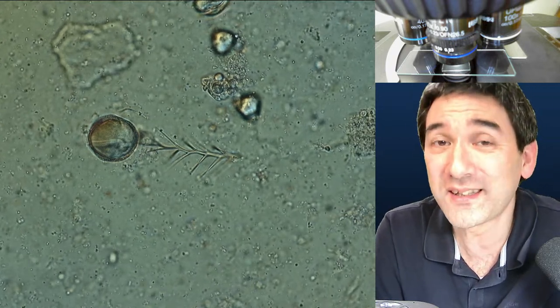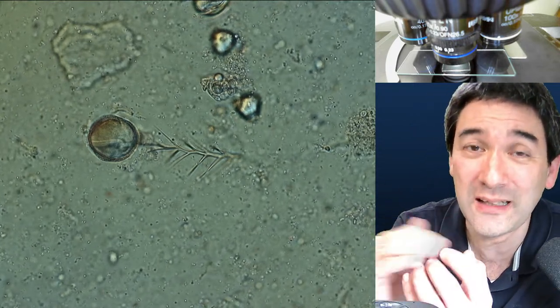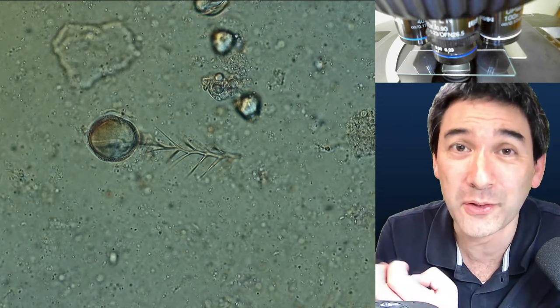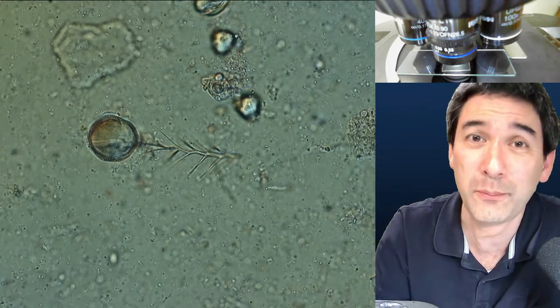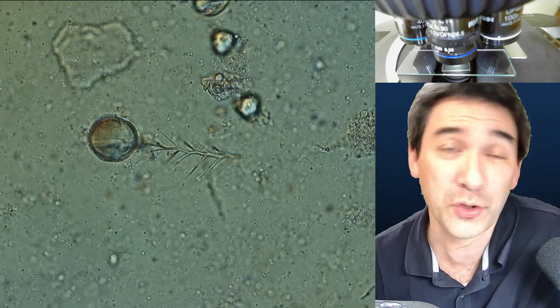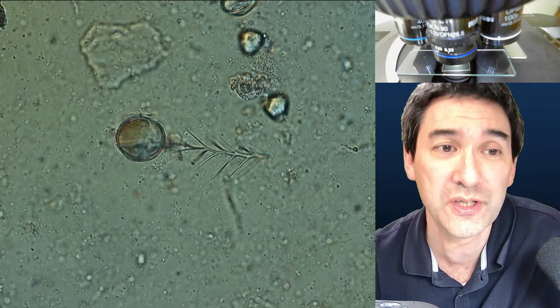In the case of heat-fixed slides, you dry the slide and then heat-fix it by pulling it through a gas flame — this causes the bacteria and cells to be baked to the glass slide. In this case you can put immersion oil directly on the specimen because they are now baked to the glass. It's a little bit like when an egg sticks to a frying pan because the proteins denature and form cross-networks with the glass. The cells stick to the glass surface, and then when you put immersion oil directly on top, the immersion oil cannot wash away the cells. For liquid specimens, I cannot put immersion oil directly on water, so I have to use a cover glass.